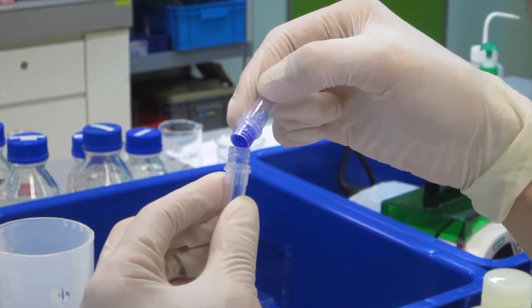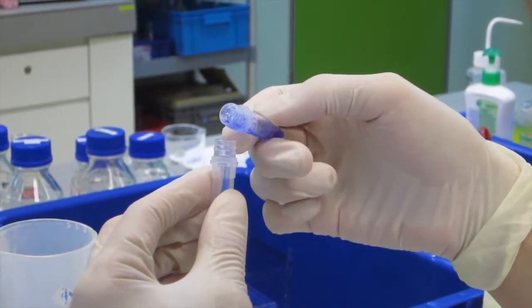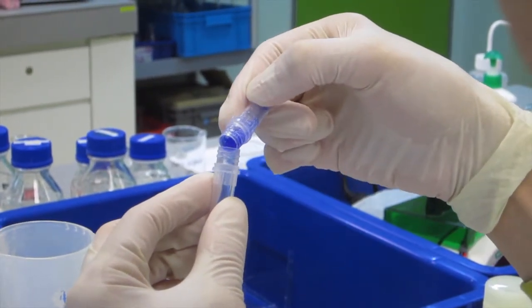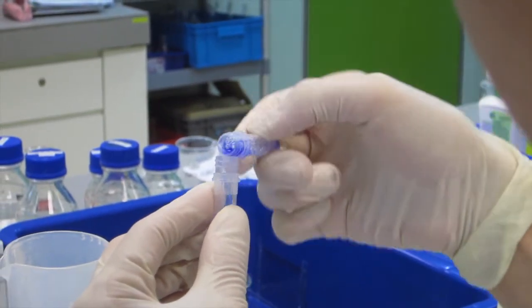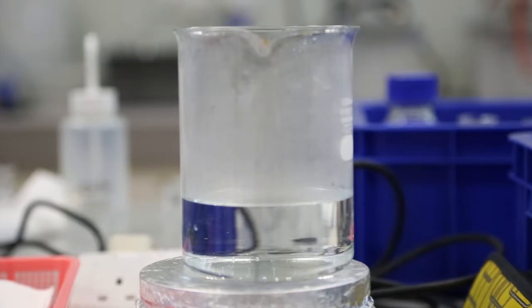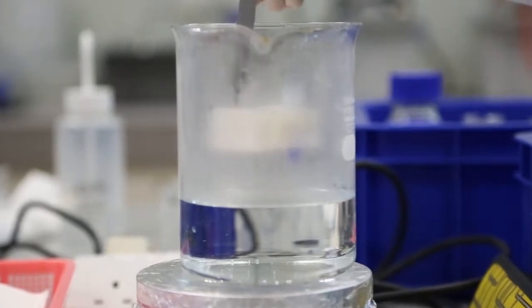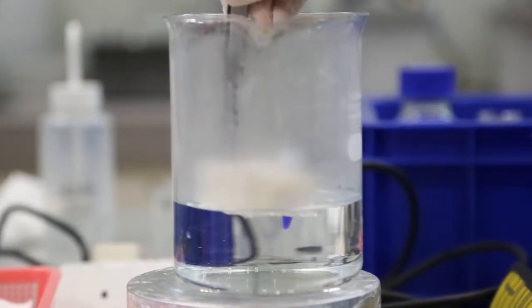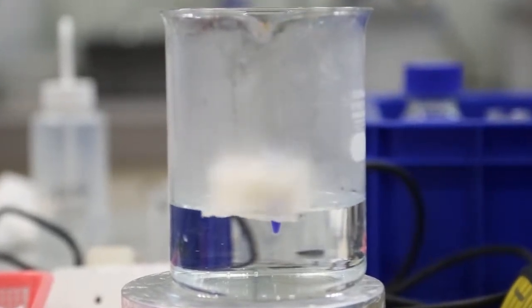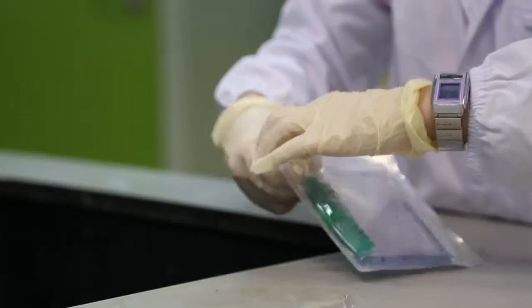Carefully pour the sample buffer containing the extracted proteins, but not the solid fish piece, into a newly labeled 1.5 milliliter screw-capped tube. Then transfer the tube into a 95 degree water bath and incubate for 5 minutes to denature the proteins in preparation for electrophoresis.